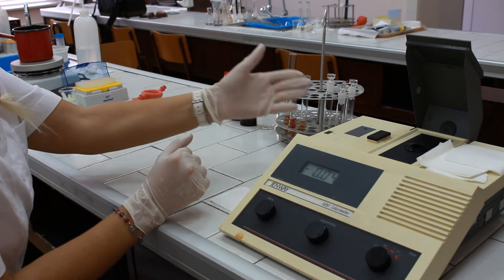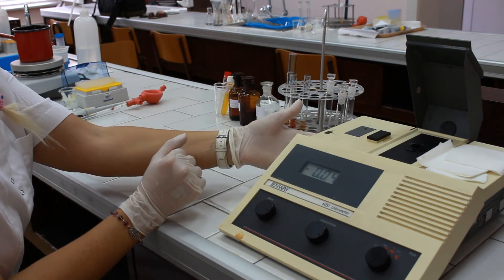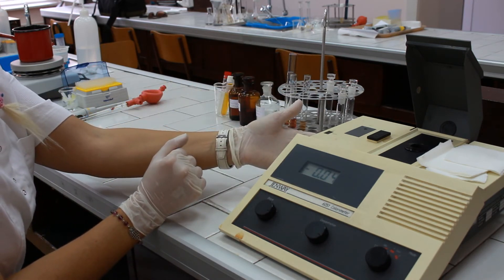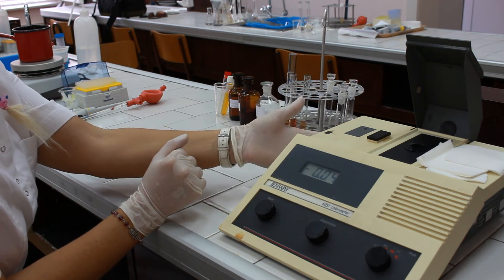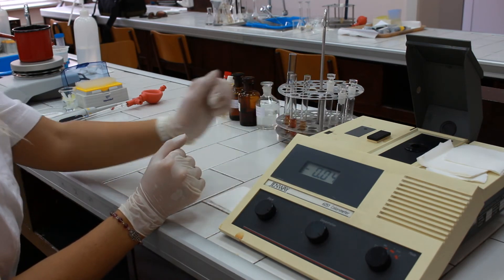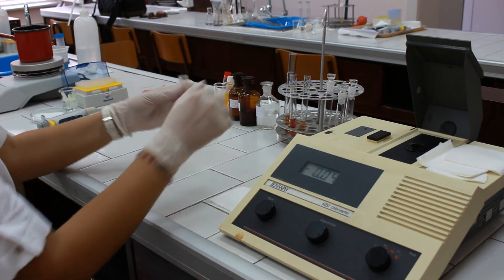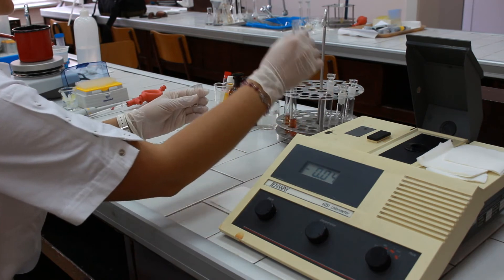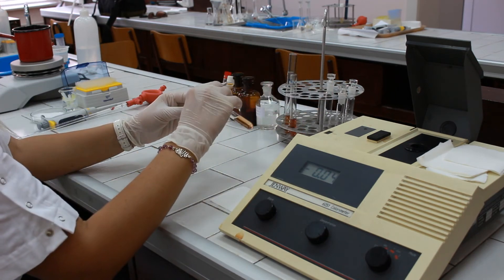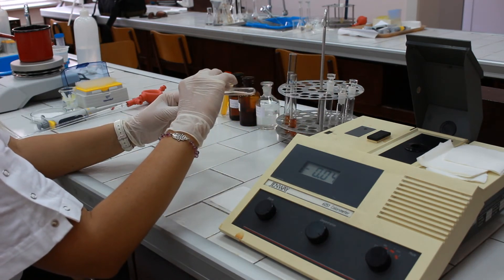First, adjust the instrument to the working wavelength — 520 or 490 nanometers. Then adjust the instrument to zero by using the blank solution.